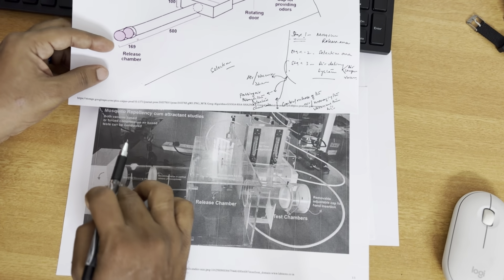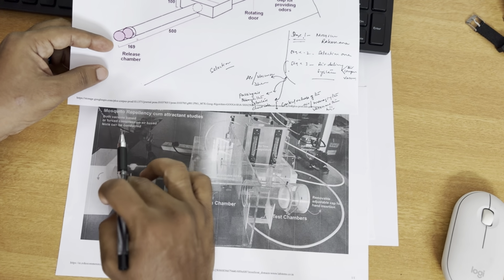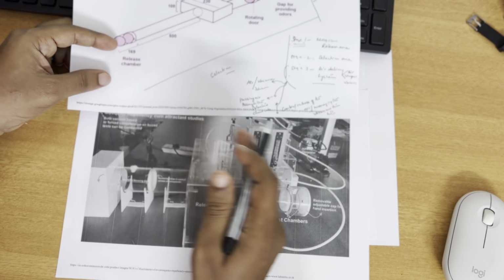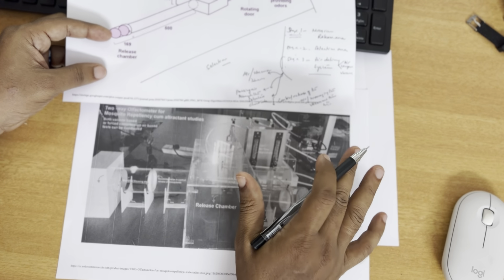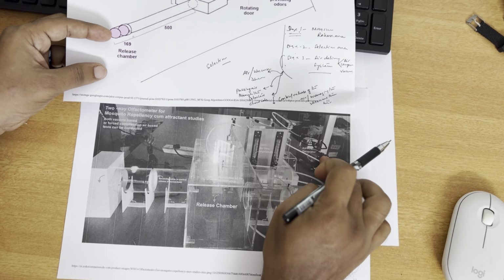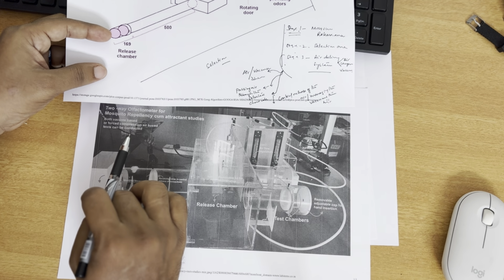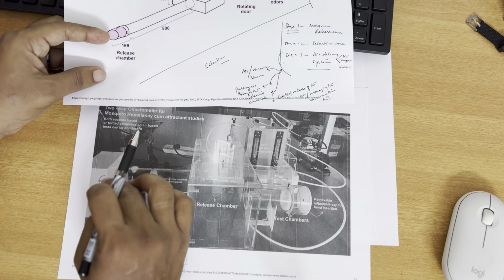This unit can be attached with the electronic unit, so that you can control the blower speed of how the air is being generated. I'm going to discuss these parts in detail, but as an initial step, I'm explaining the complete parts you may have received and how you need to look at the olfactometer. This is the compressor. The compressed air can be sent to the system. If you want to use the vacuum based, you can use this particular air delivery system.